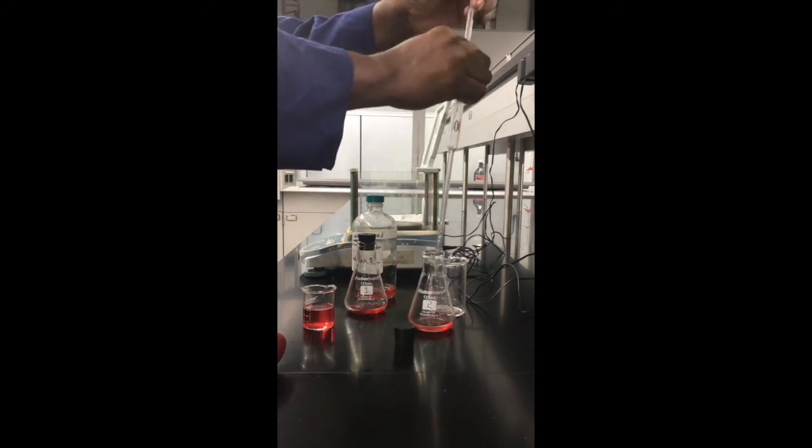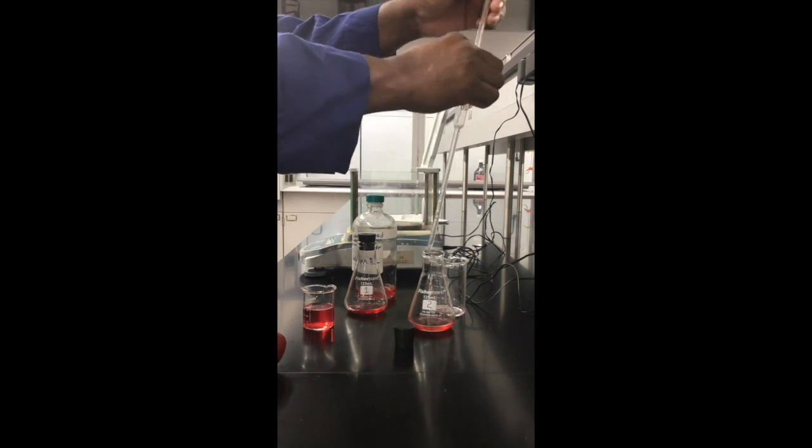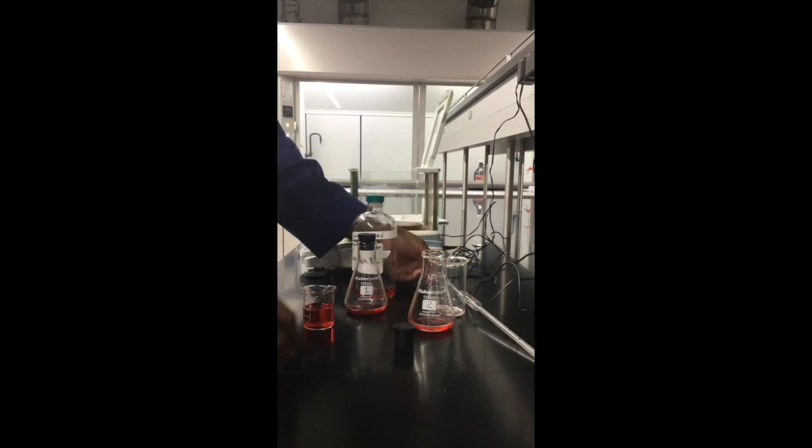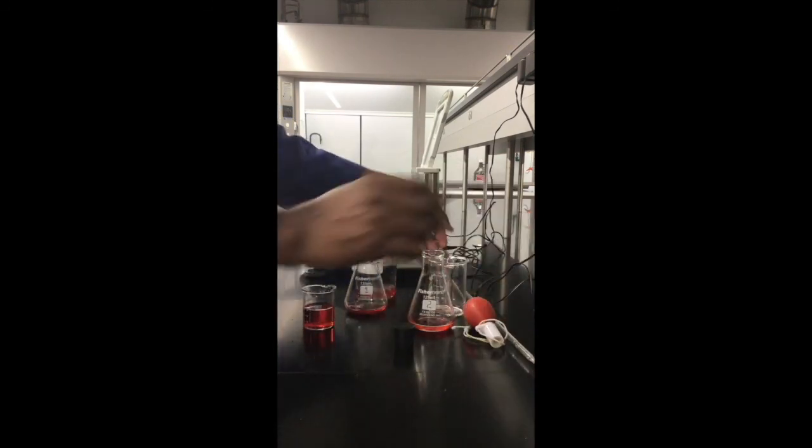So we are done with this. If something remains there, that's fine. If something remains at the bottom, that's fine. I'm just gonna place this one in a safe place.